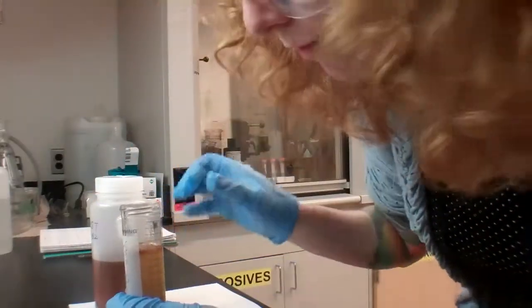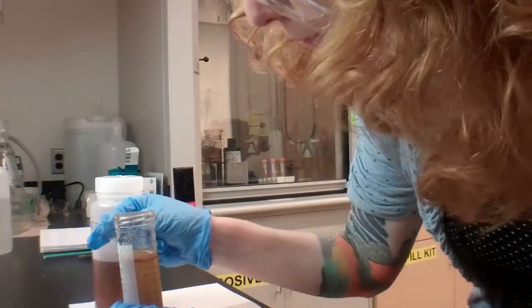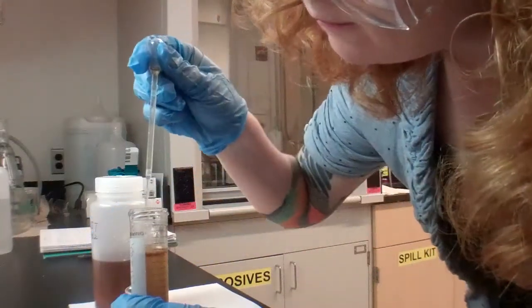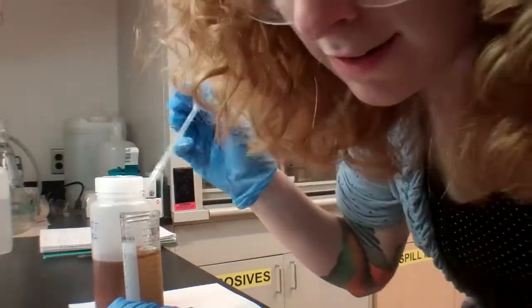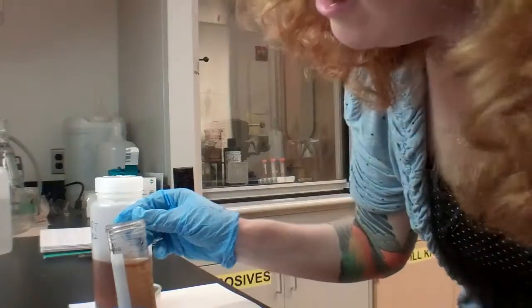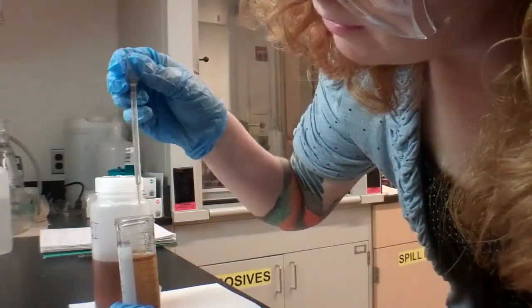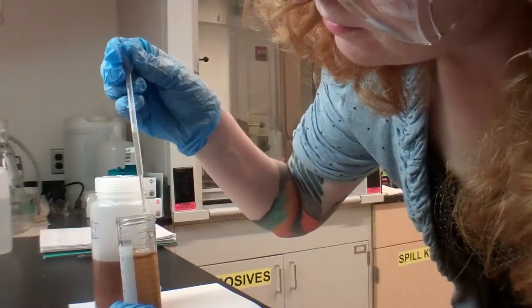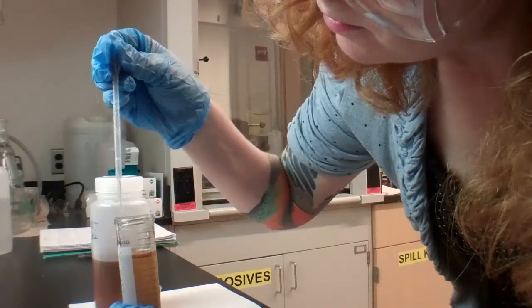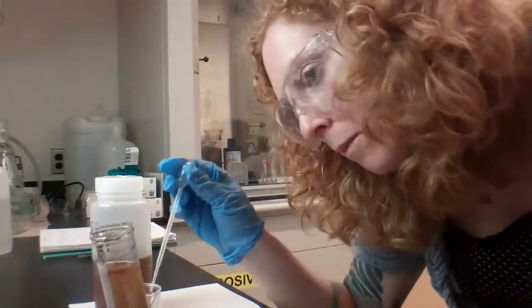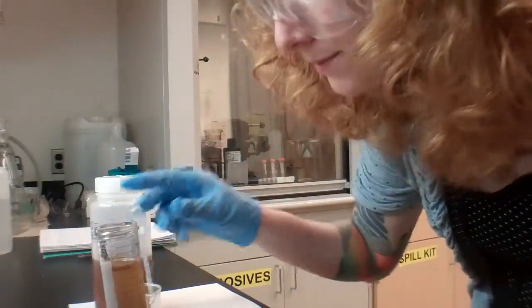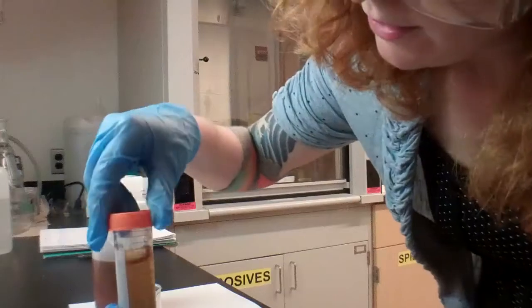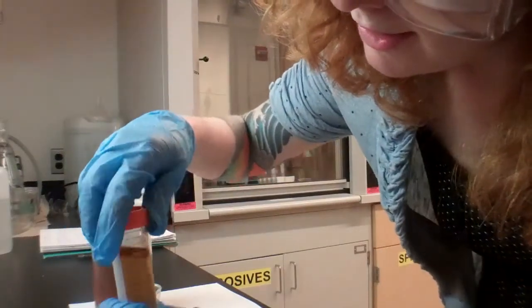We really want to get every little grain because we might be able to find exactly what we're looking for in those little grains that are stuck to the sides. This is very detail-oriented work, but it's pretty cool, fun. Cool and fun. We're looking good. All right. I'm going to screw this on.